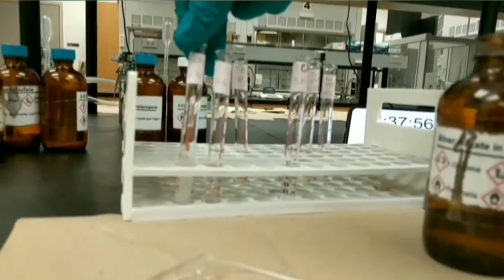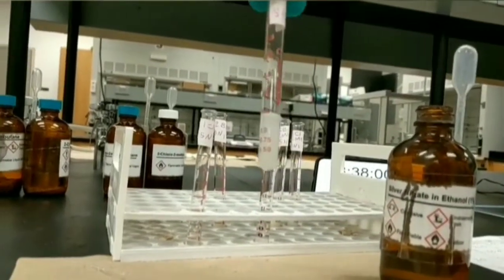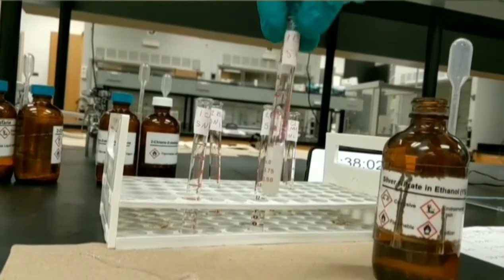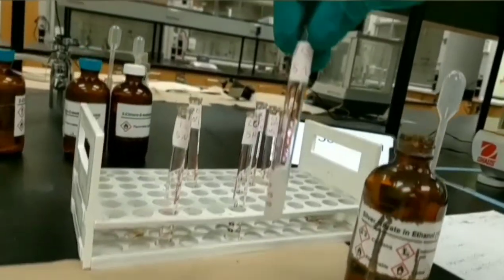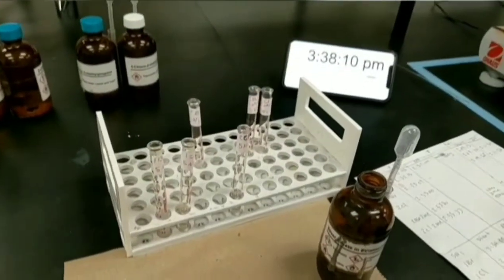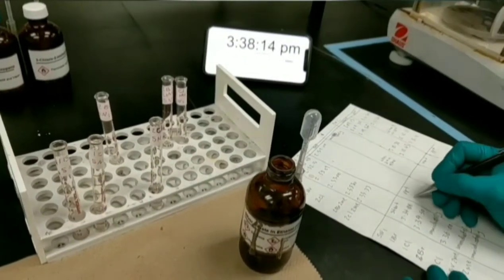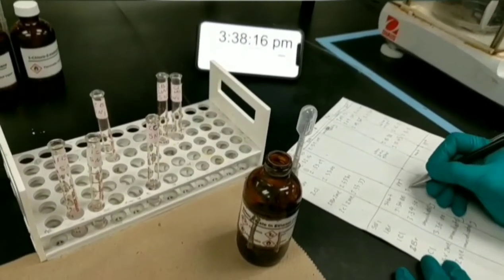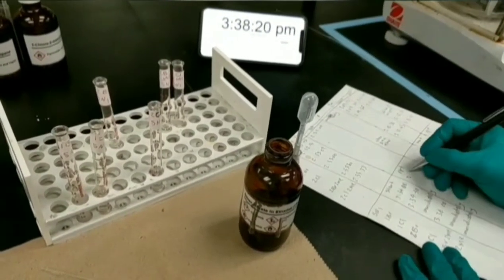For 1-bromobutane, we can see precipitation. Record the time, please, for end of the reaction. This is a primary alkyl halide, which is not proper for doing SN1 reaction because primary carbocation is not stable enough. This precipitation shows a positive error, which is related again to elimination reaction.